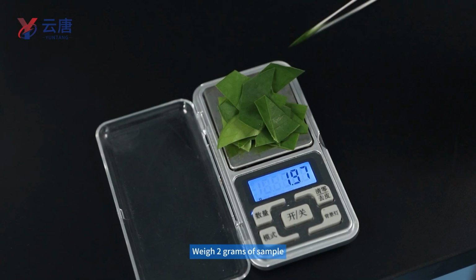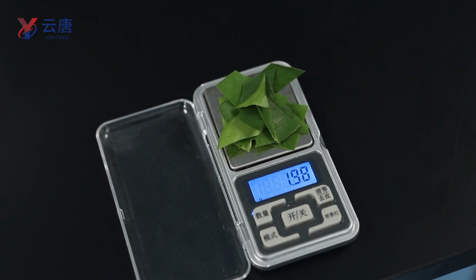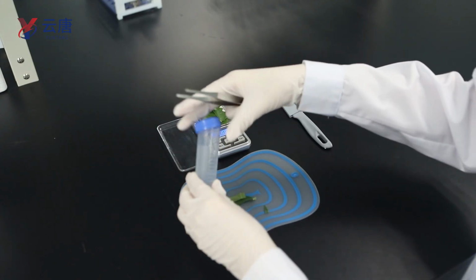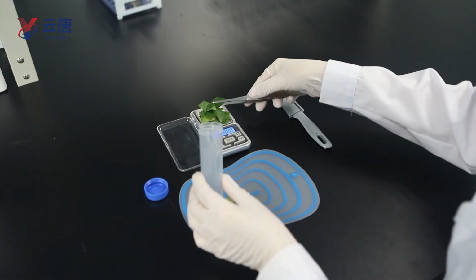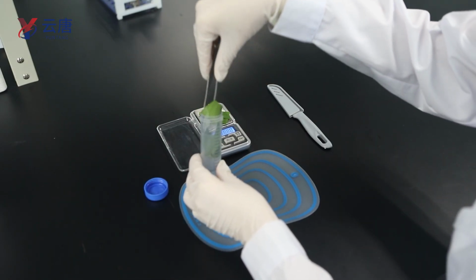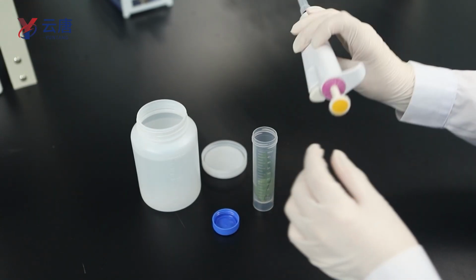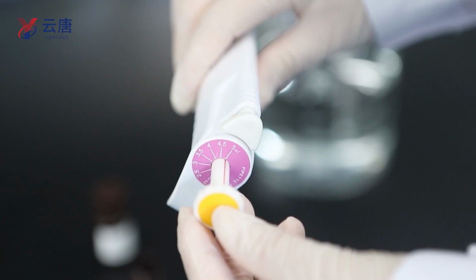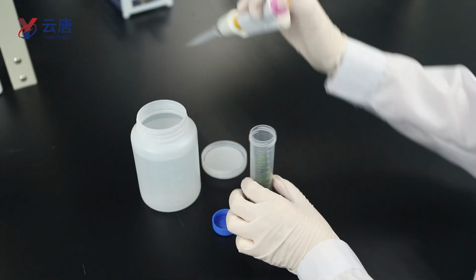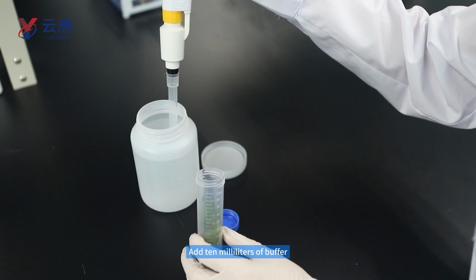Weigh 2 grams of sample. Put into the sample tube. Add 10 milliliters of buffer.